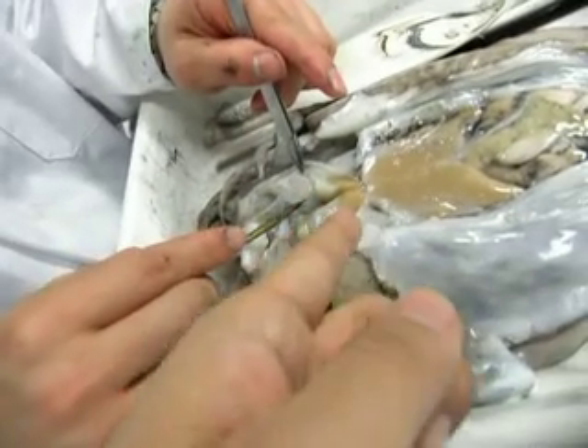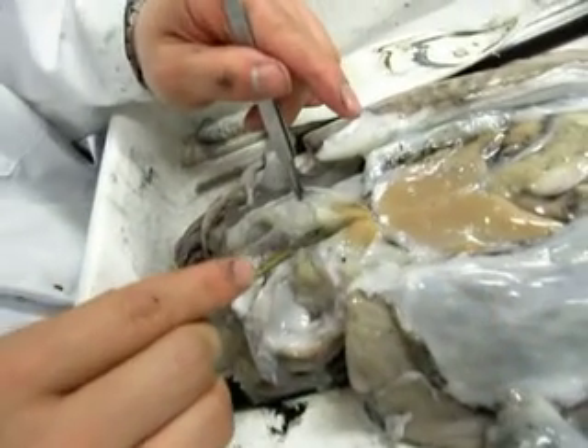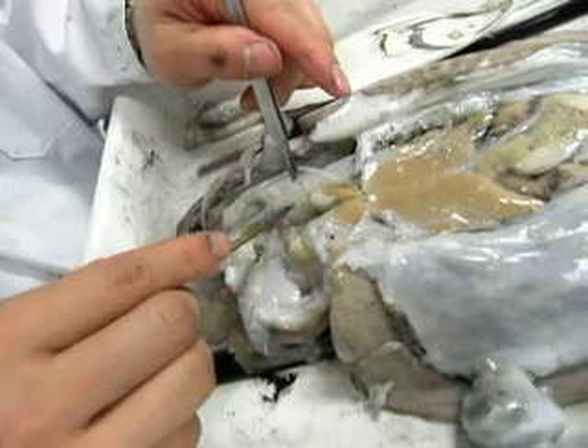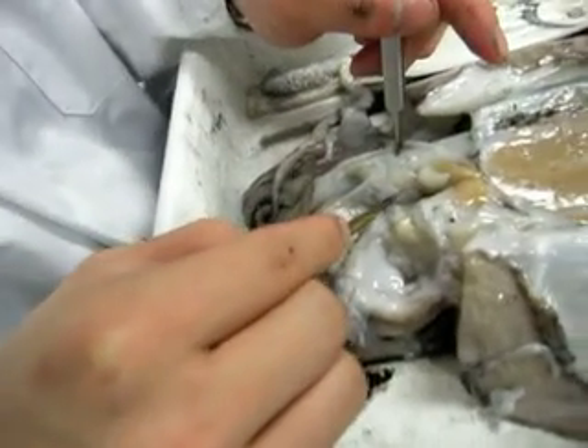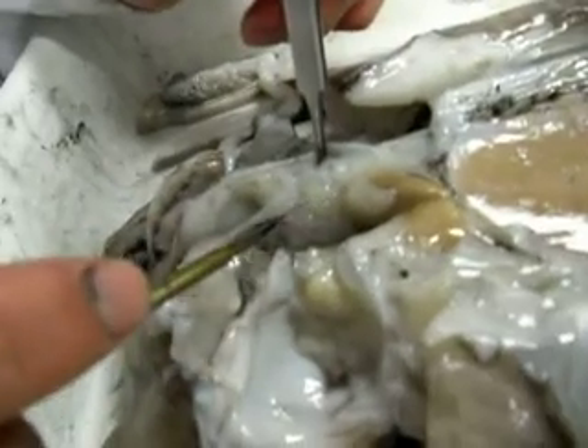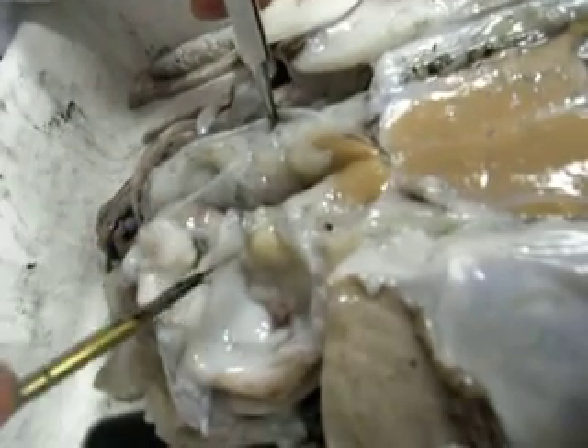So what's next? Is the salivary gland connected to the liver? Yes, it is. So the brain is sort of here, and you can see there's actually a bit of a structure in the brain, which is quite intriguing.